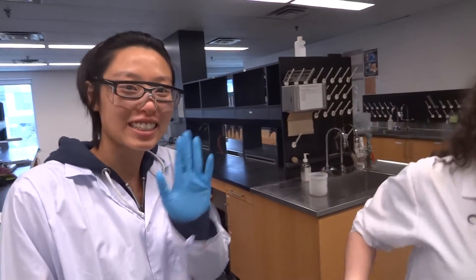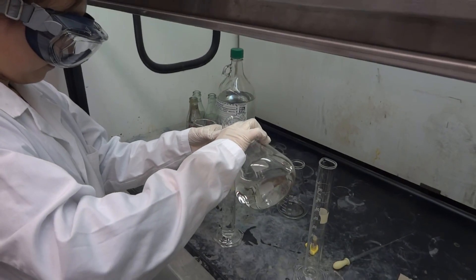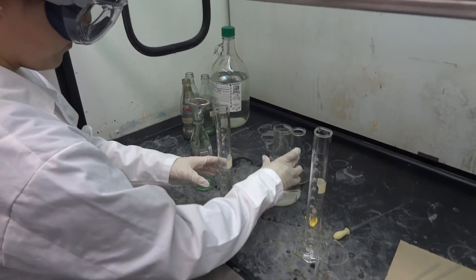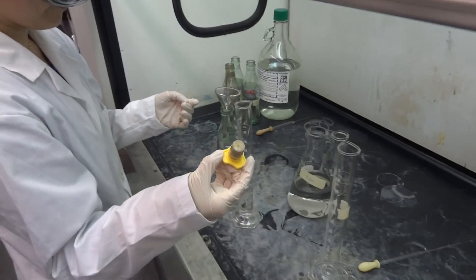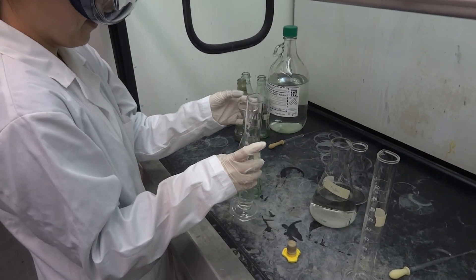Thanks to the help of other students, Rebecca and Rima. So about 50 milliliters. What's going to happen is she's going to mix the two of them together in the bottle, then take the funnel out, put the stopper on, and start shaking it fairly vigorously for a few minutes as the mirror begins to form.